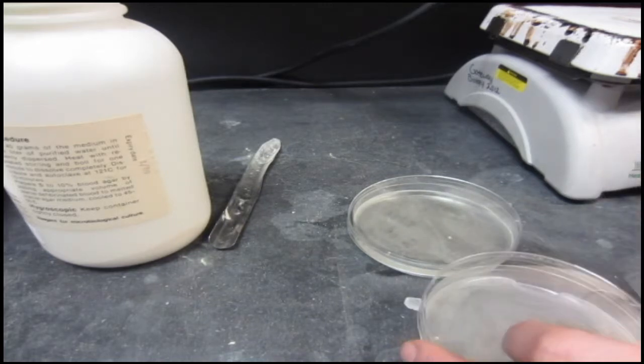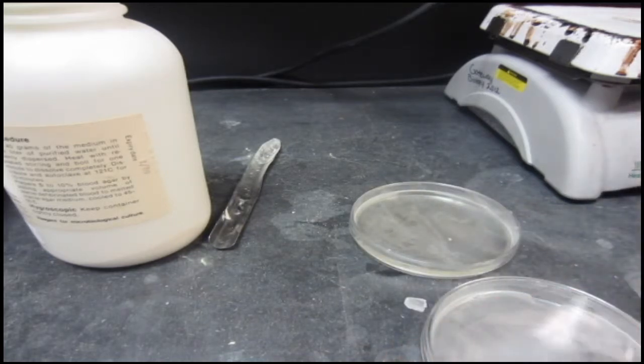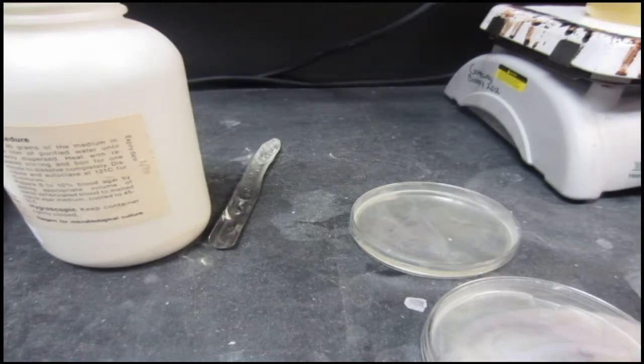Then this agar just needs to sit, it needs to wait, it needs to solidify into a jelly-like substance, and then it'll be ready to add the bacteria.